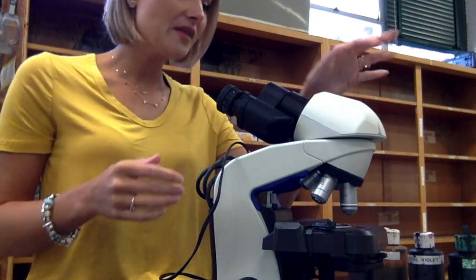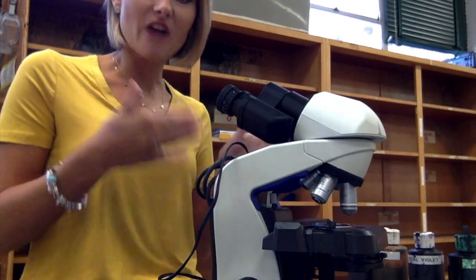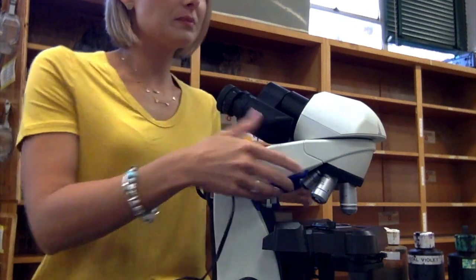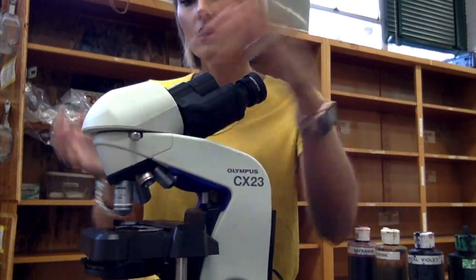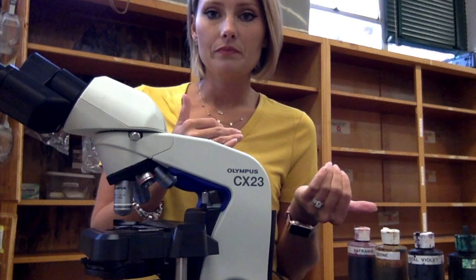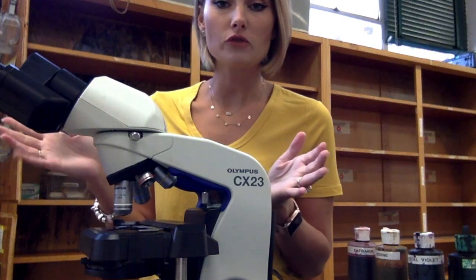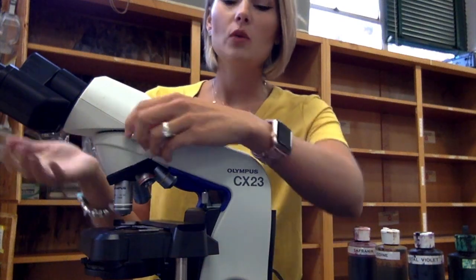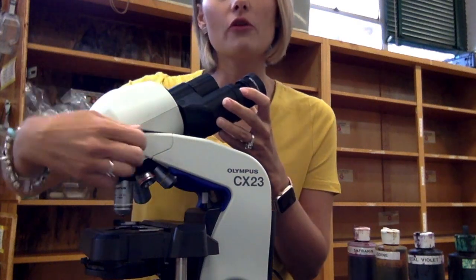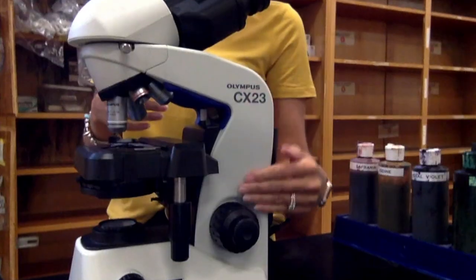This is the binocular tube, which is where the ocular lenses are held. It does swivel — right now it's swiveled toward the back of the microscope, but you can loosen the little screw here, swivel it forward, and then tighten the screw back. It works either way, whichever is most comfortable for you. To store them in the cabinet, we do have to swivel them back so they'll fit. And here's the arm.